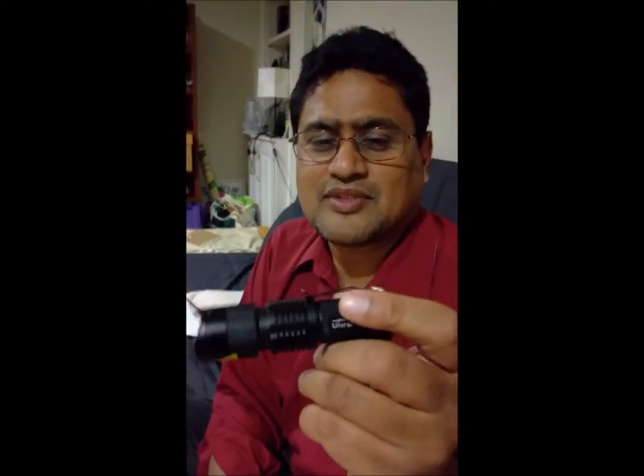That's cool. Yeah, but the problem is that I've been trying so many different kinds of LEDs and none of them have been satisfactory, basically because they're not very bright. So finally I think I got this guy who's supposed to be ultra bright. It's called Ultra Fire. It's a cheap LED — it's actually a flashlight. But I'm going to try and see how this works.